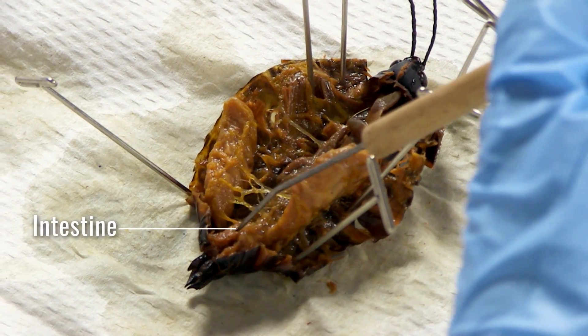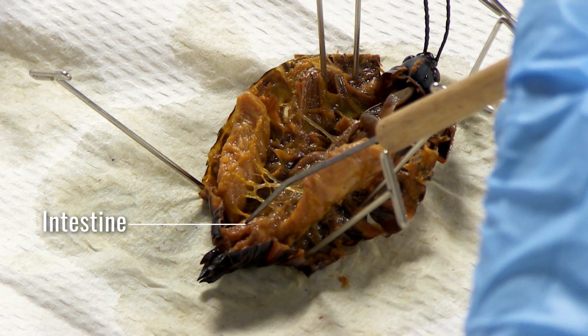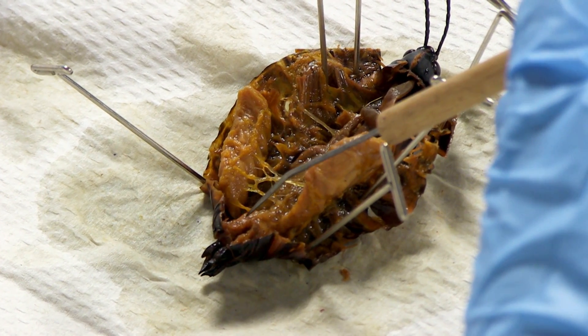Next, observe the intestine. The intestine transports waste out of the body.